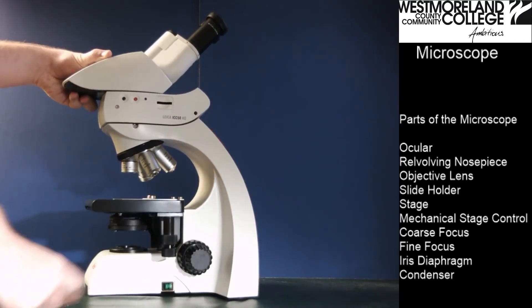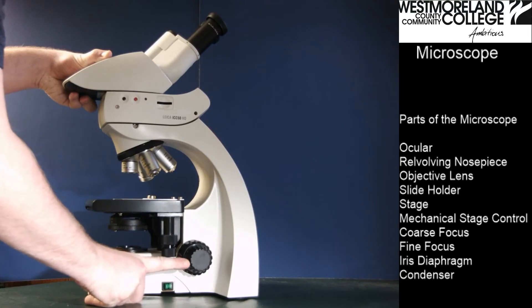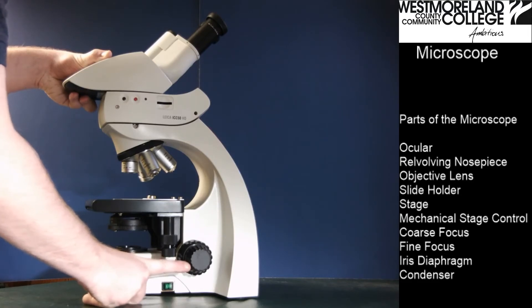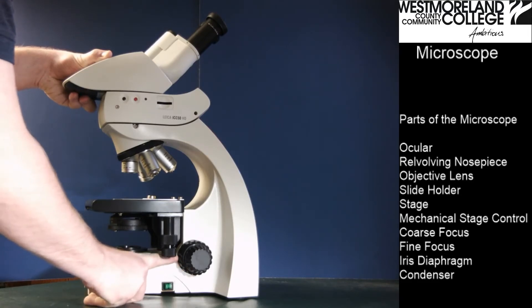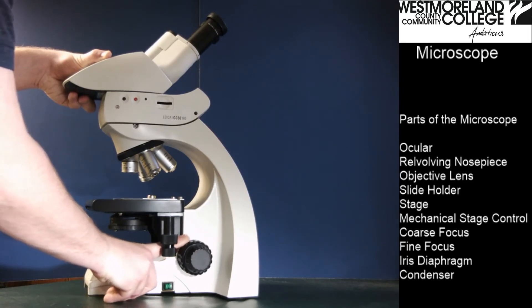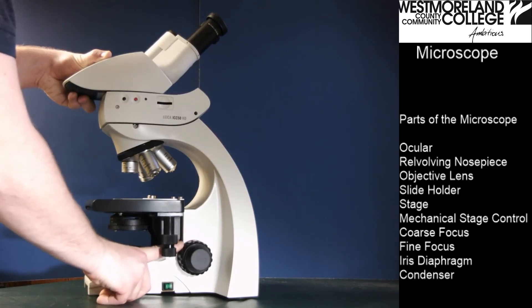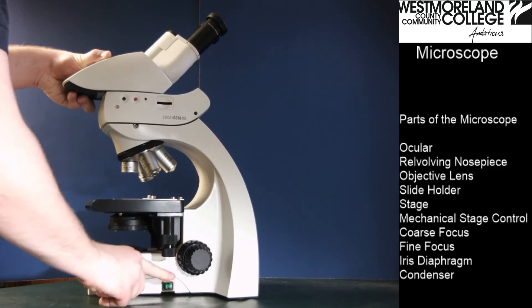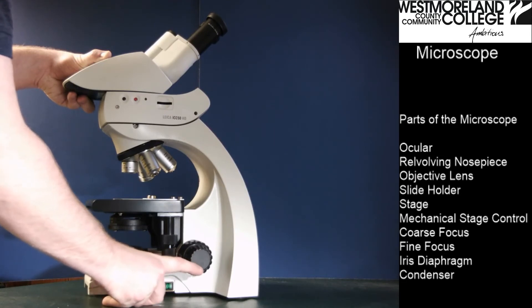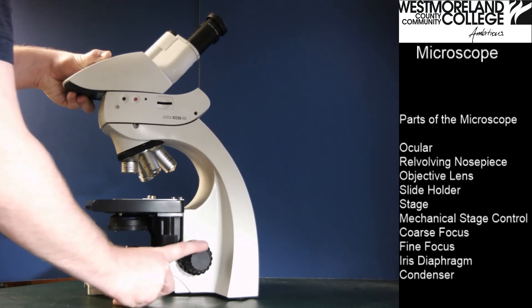We can also see the coarse focus and the fine focus. The smaller one is the fine focus and will move things very slowly. The coarse focus moves things very quickly, and you can see how much it moves compared to the fine focus, which gives a lot more control.